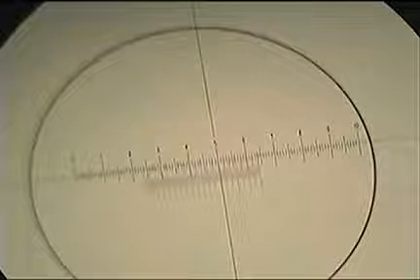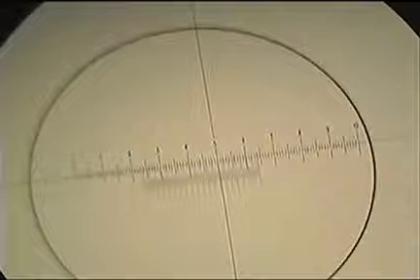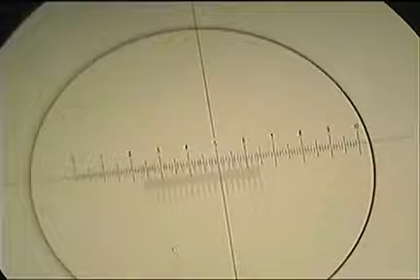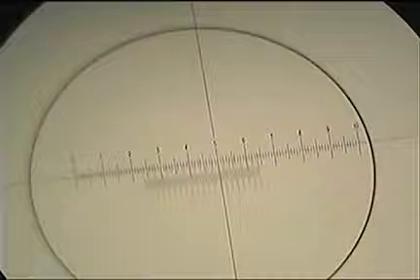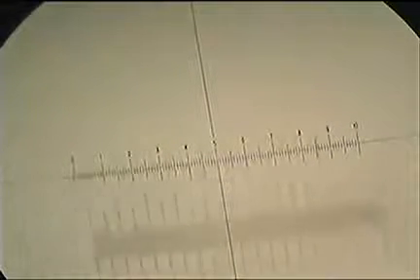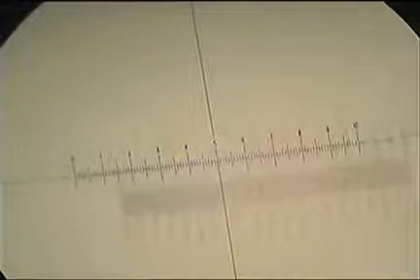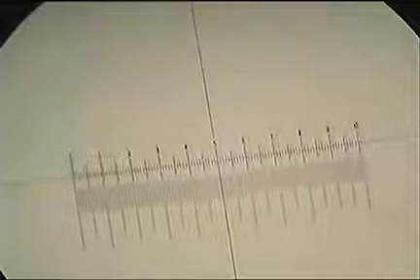We're going to try and measure things under medium power, so 100 times magnification. So we're going to go on to the medium power here. If you calibrate the microscope, you have to do it under a certain magnification. If you change magnification, you have to do the calibration again. In theory, you can multiply it, but it's probably better if you just do it again. So we're going to calibrate it under medium power. So here's me trying to line up the two scales.